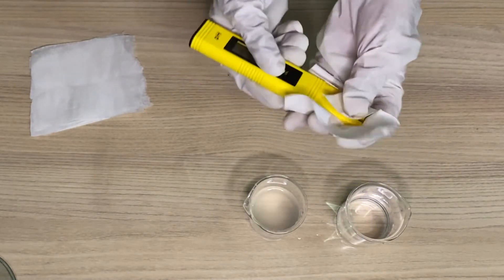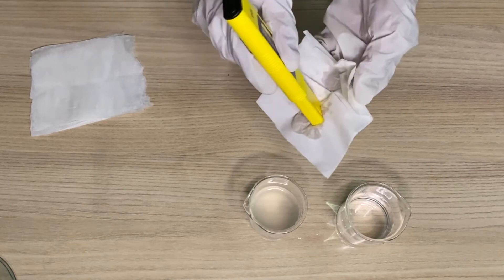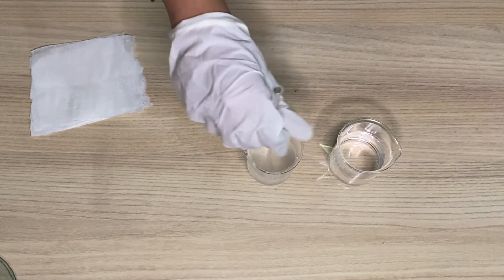And wipe it with a paper towel. Now we will stir our product first.